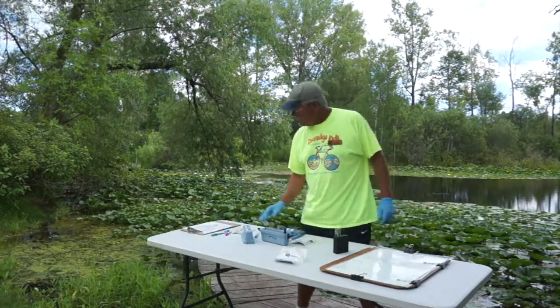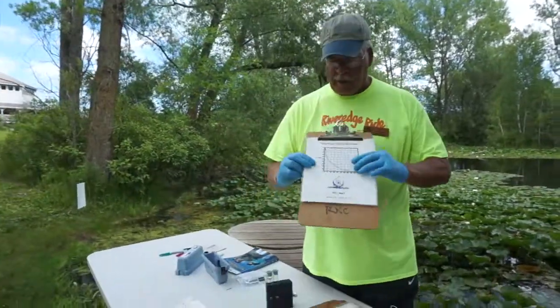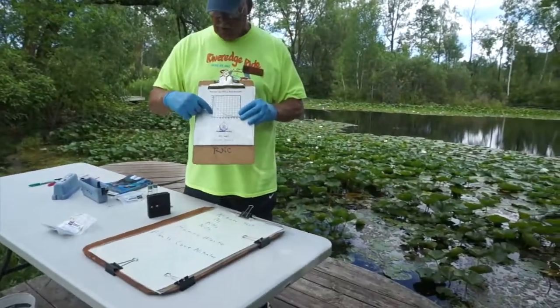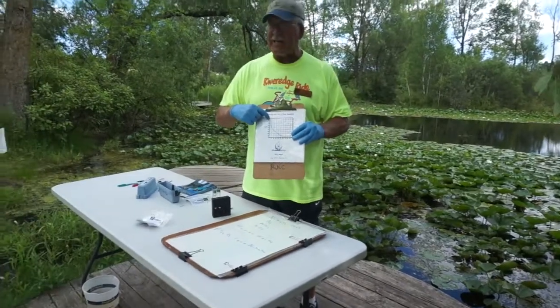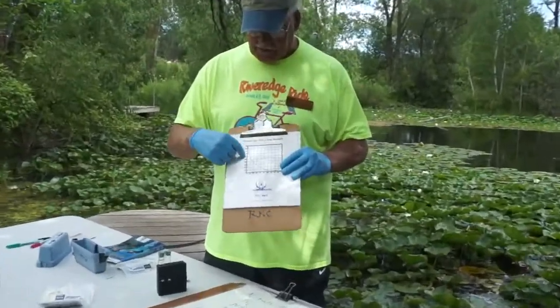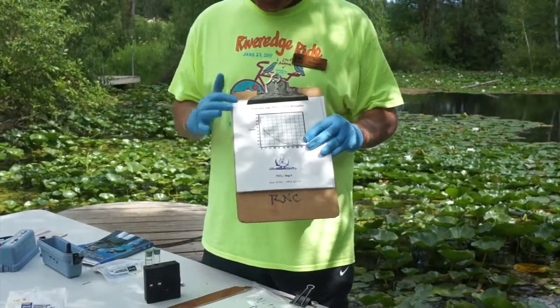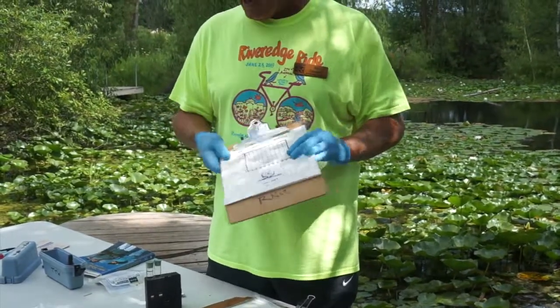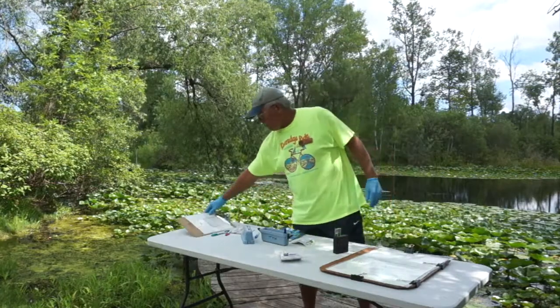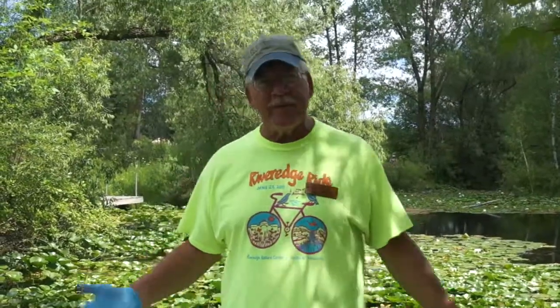You can go back to your chart here. We almost always got a zero, which was 100% — a Q value of 100. Remember, we're taking a quantitative value and turning it into a Q value of 100. Our river always performed a perfect score on the nitrate test. So that's the test — simple and straightforward. Good luck with it.